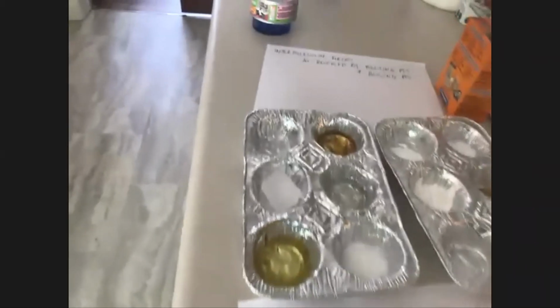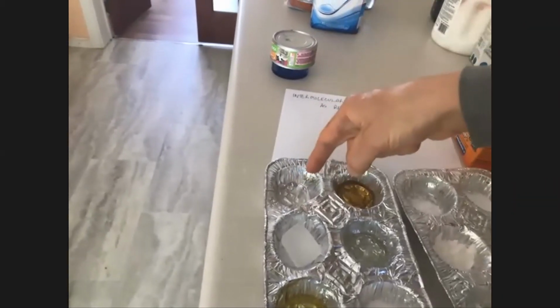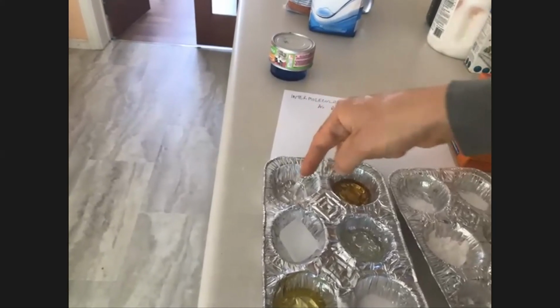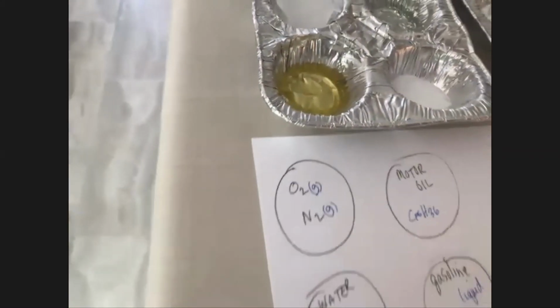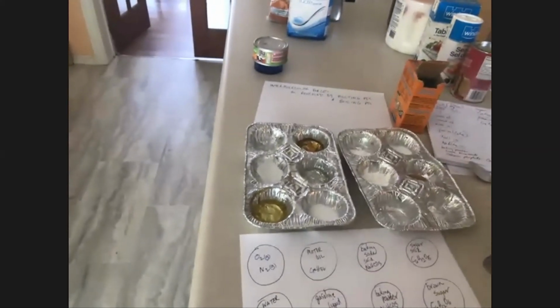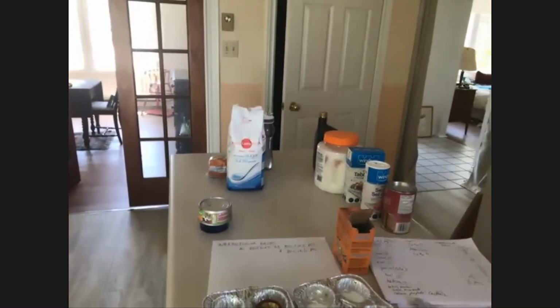Yeah. Okay. Now, the last one, the oxygen and the nitrogen, I didn't do anything, but it was already in there, right? Because it's air, it's a mixture of air, and so it's in there already. So we know those ones are both gases. How's that so far? Looks good. Did you find anything else for the last 2 slots? No, I think that's where we're at today.